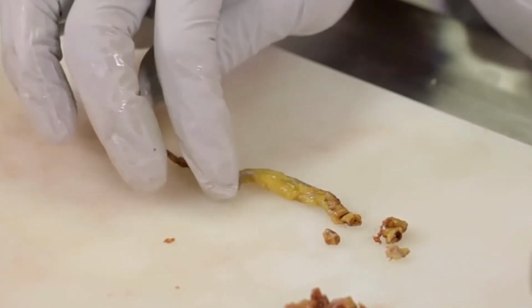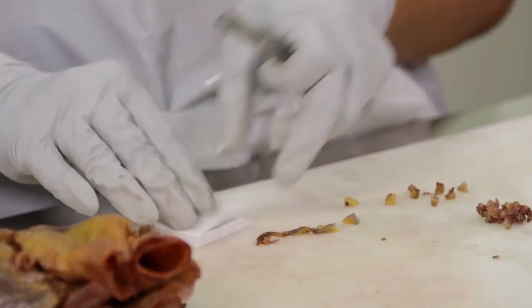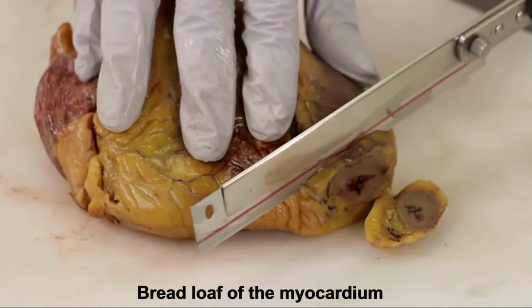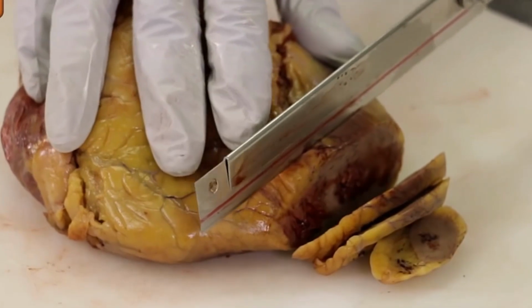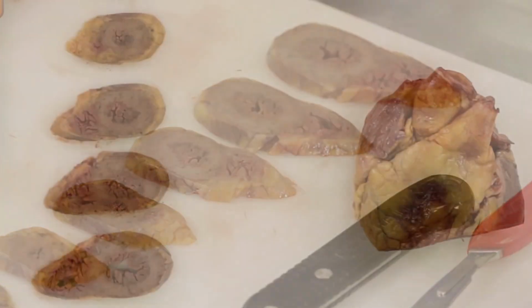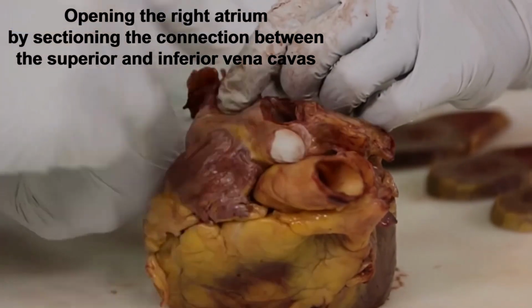And it depends on how much involvement of the atherosclerosis and thrombi you're going to find, that you can submit more. Now this is a very important part, that is the bread loaf sectioning of the myocardium, starting with the apex and about 4 to 5 millimeters thickness, but this is done only up to the half of the heart before the location of the valves, and then we can align the different sections in a consecutive order to be able to take the corresponding pictures.